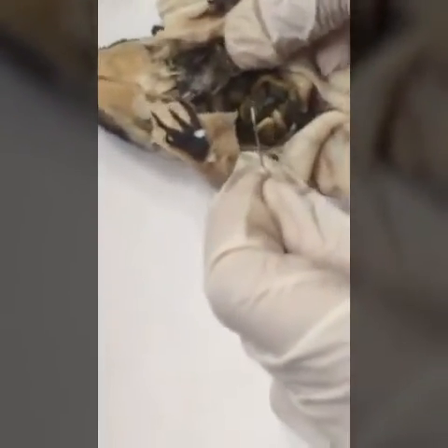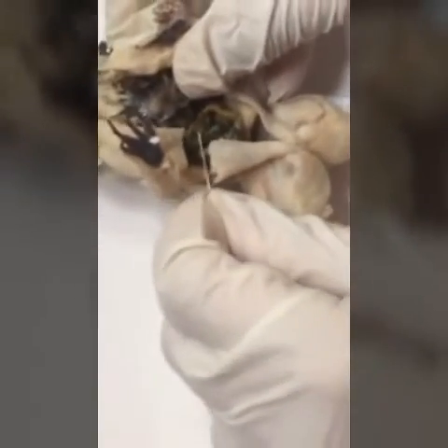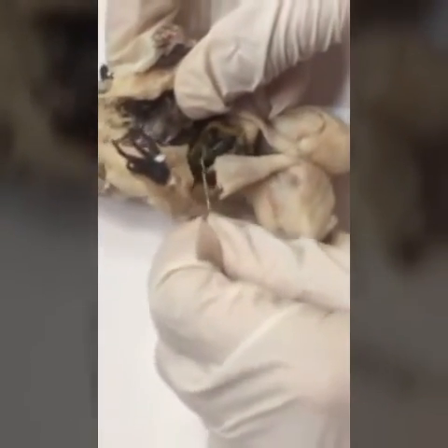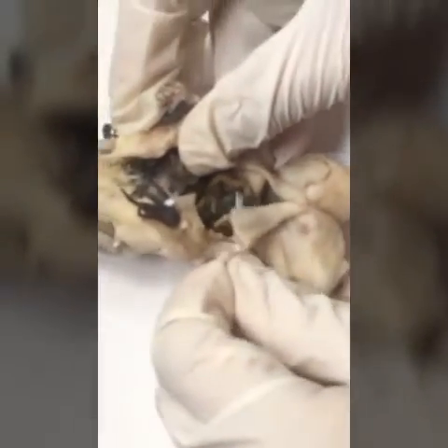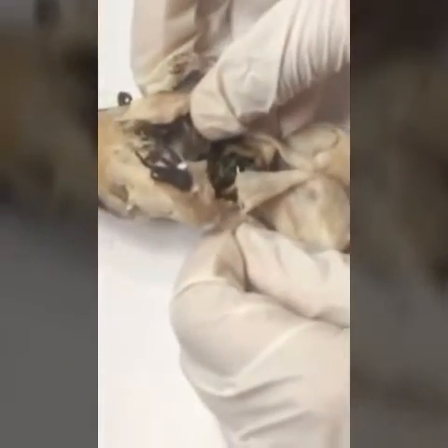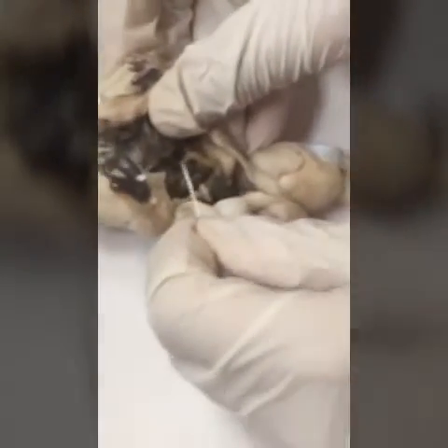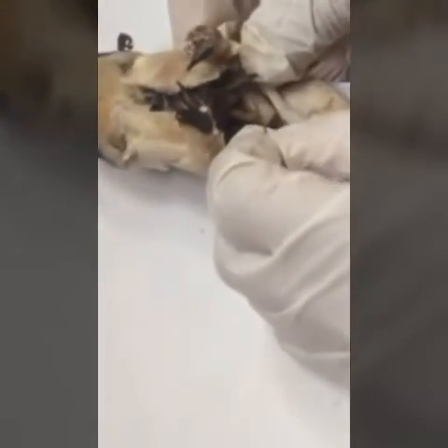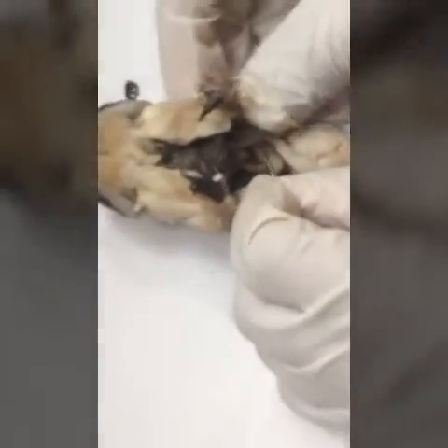Then you can see the ileum right here — the most coiled part of the small intestine. Then you can see the duodenum right here. And here is the stomach, which is right here.